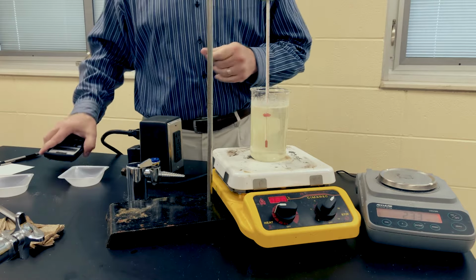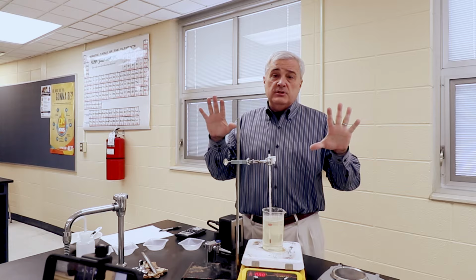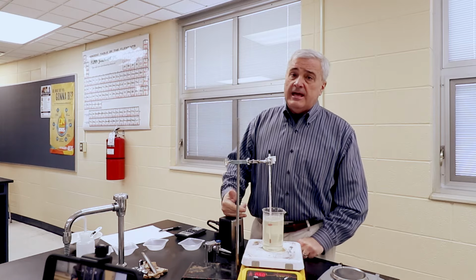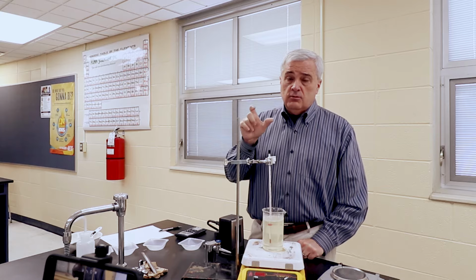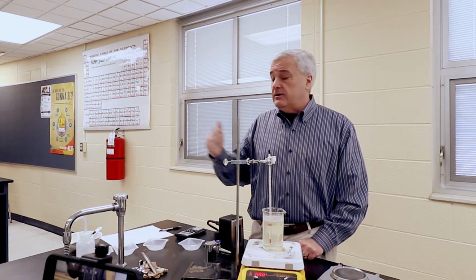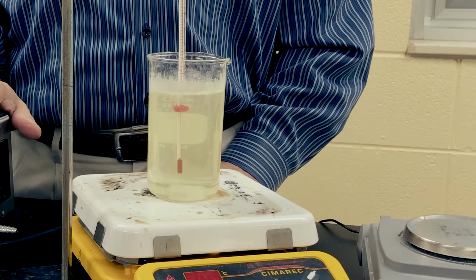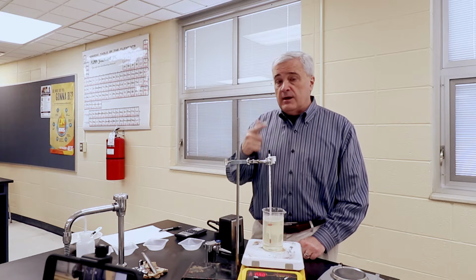All right, we're going to break this down, and I'm going to talk about the results. So if you're doing this as a virtual lab, we have collected the data. In the next section of the video, we'll go over the collected data real quickly, and then we'll calculate the results. What are those concentrations? I've got to add all this up and come up with that final mass. So I'll be right back.